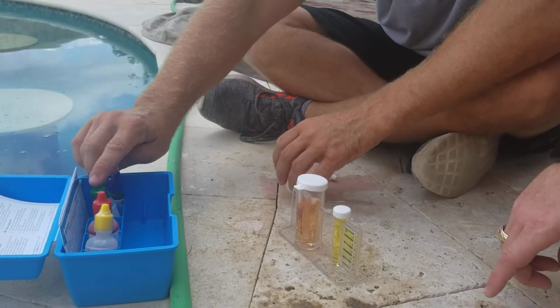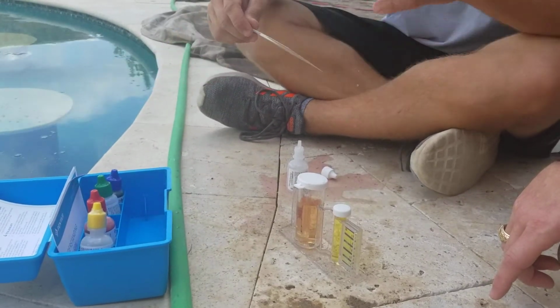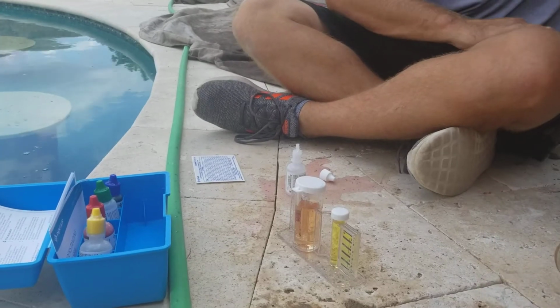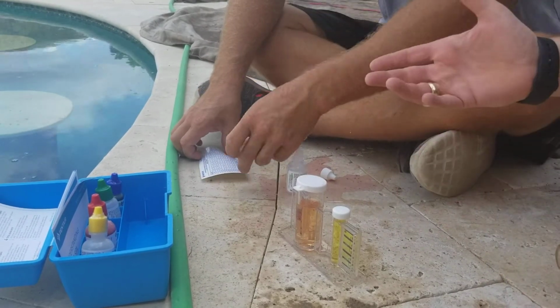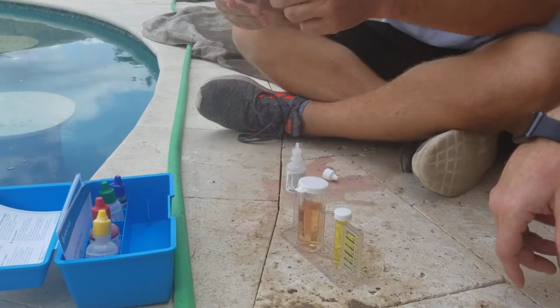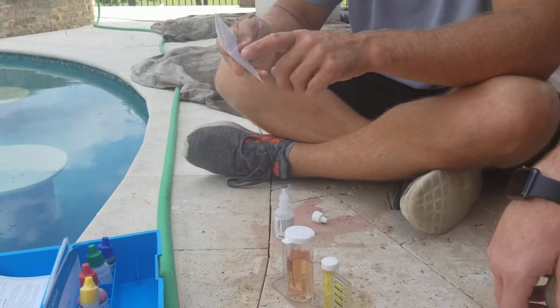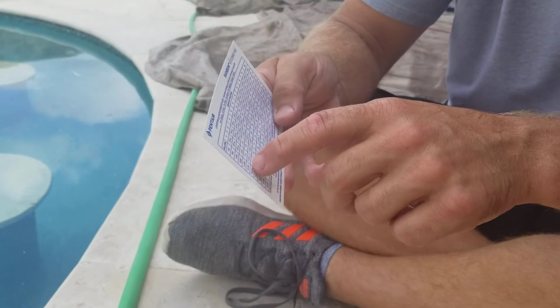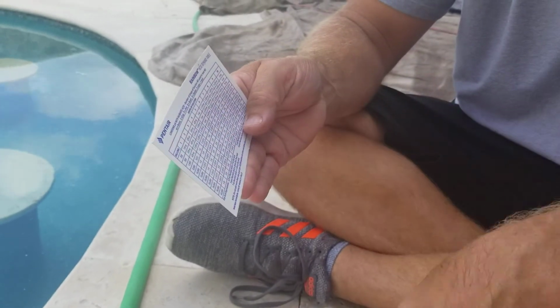So now we go to our chart here. Your pool, 38,000 gallons. 38,000. Okay. With the spa. Perfect. I was going to look that up. 37.9 is what it is. Yeah. So we go into a chart here, and it was 5 drops. So this chart has all your gallons on this side, how big your pool is, and this is how many drops it took to lower it down to your ideal level.